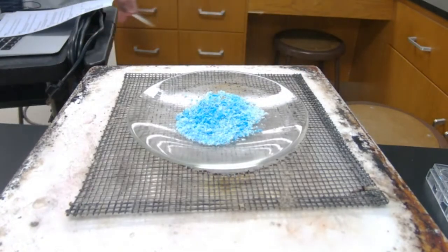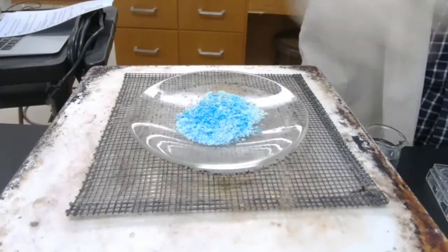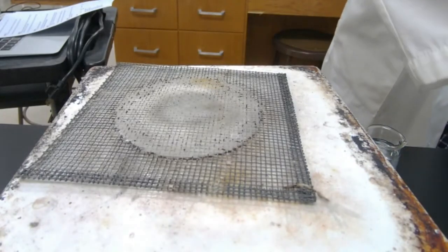And I've got to go get my vinegar, also called acetic acid. That's the technical name for it. So what I'm about to show you next is, I'm going to pull this off. Oh, I almost spilled it. Pull that off so I can use it for the last segment. I'm going to transition your attention back to my well plate. Make sure you stay in place so you don't fall down and bump your head.